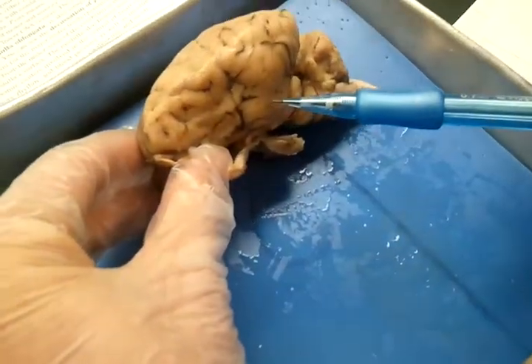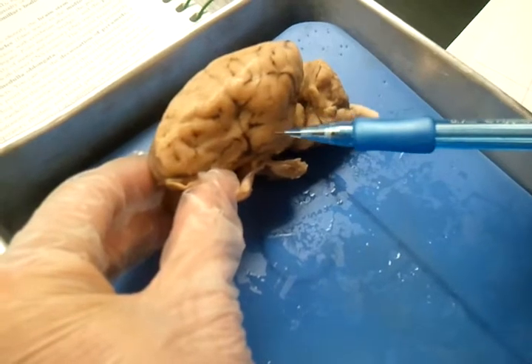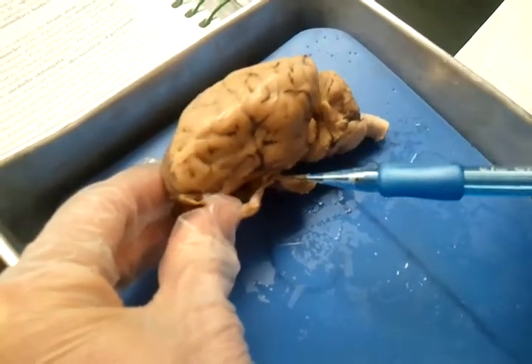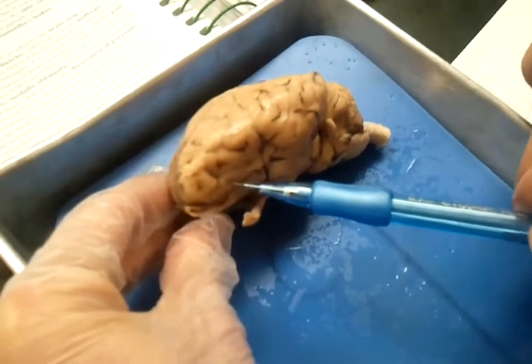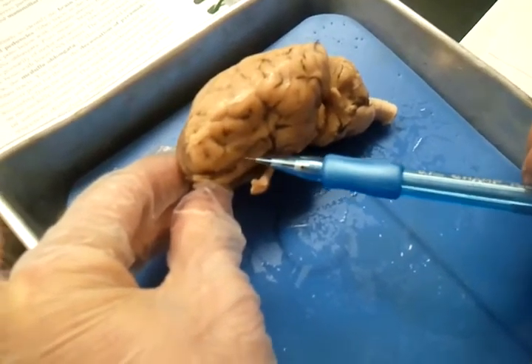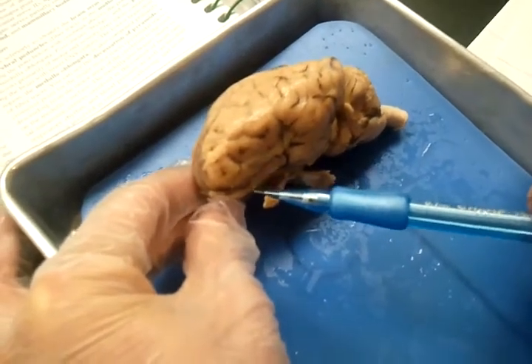A little bit farther down, we're going to go to an area that is the working memory for object recall task, where it recalls everything. And right under here, we have a solving complex where it multitasks different problems.